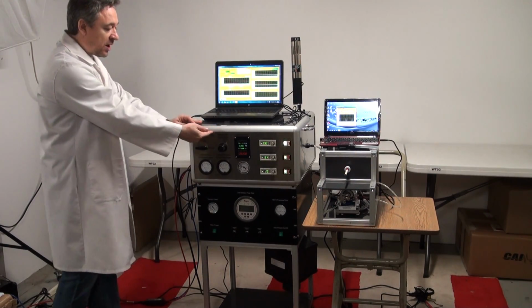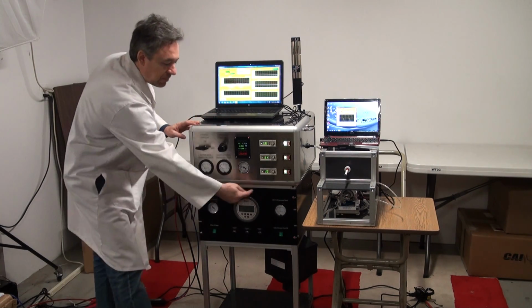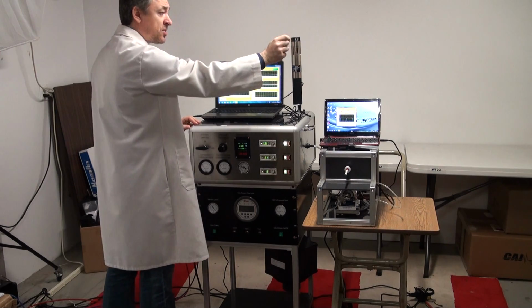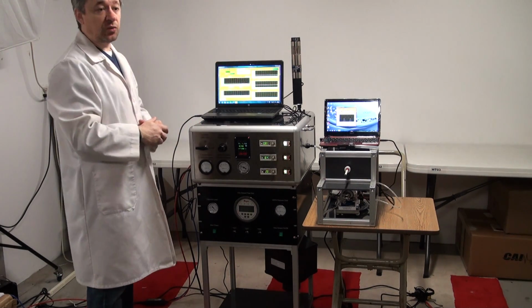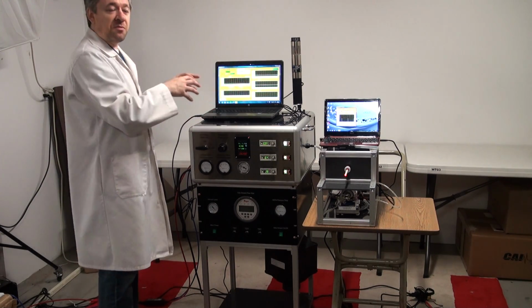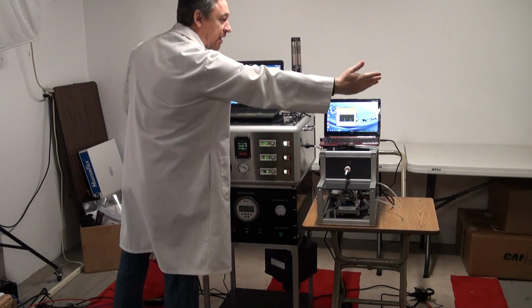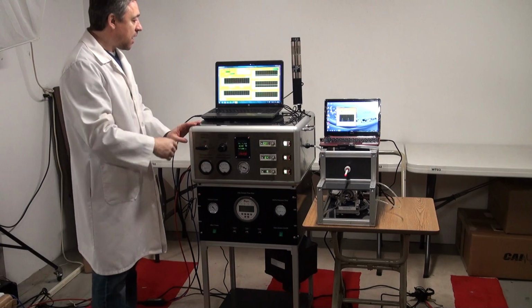So the mainstream smoke comes through the siphon, goes into the mixer, mixes with side stream, and goes to the inhalation chamber, and there the aerosol monitor measures the concentration, which is then compared to the set concentration in the software. Obviously, in this latter case, the control loop of the mass flow control will be different, so the PID values will be adjusted to account for the length of the sampling line from the inhalation chamber.